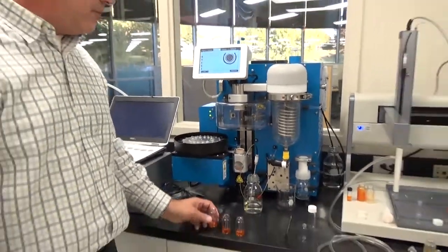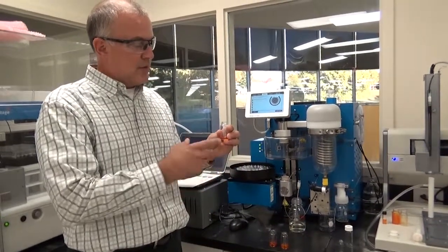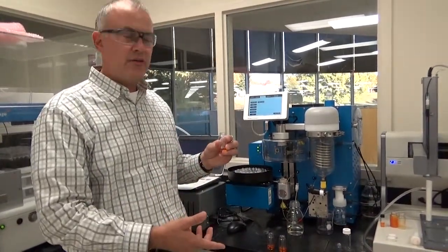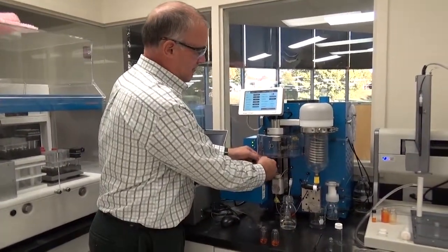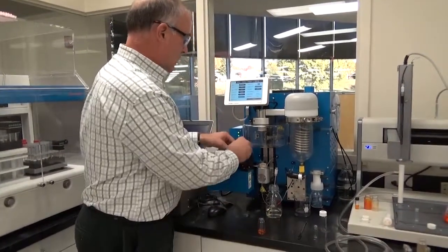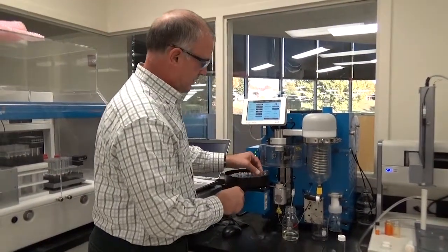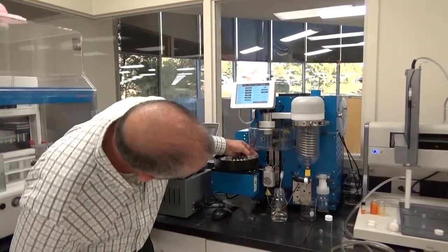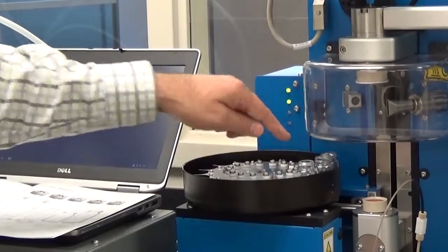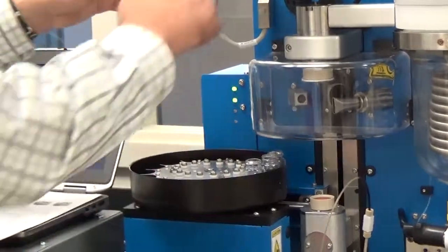Now these are some reaction products that I've collected. I want to dry them down and I want to replace the solvent with my carrier solvent. Go ahead and you just load the vials into the carousel. You'll see the letters here, position A, B, and C. Make sure they're all level across the top. The A vial kind of sits in midair here, so just line the tops up so that it's even.